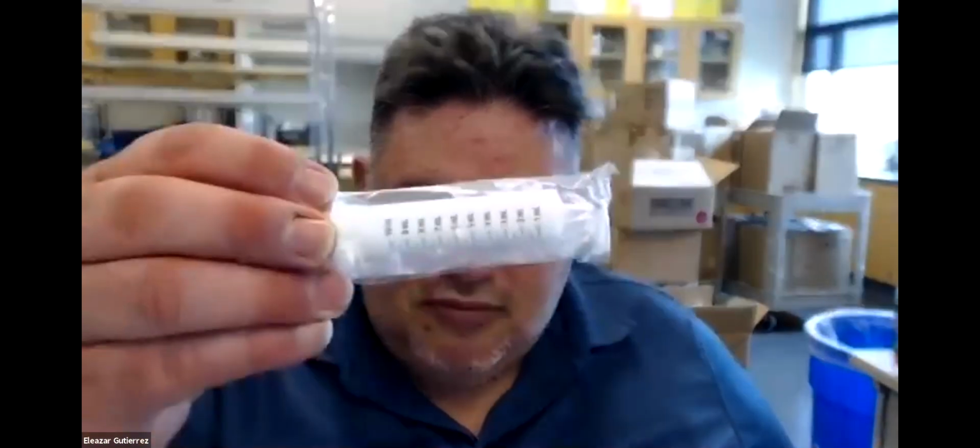Okay. But you have to be careful. Half the discs have to be spinach that's been in light, and the other half of the discs has to be spinach that's been in darkness, because that's the other experiment that we're doing. Okay, so you're gonna put your 10 discs of leaves in there. You're gonna take your 0.24% solution, and then you're gonna go through the degassing.